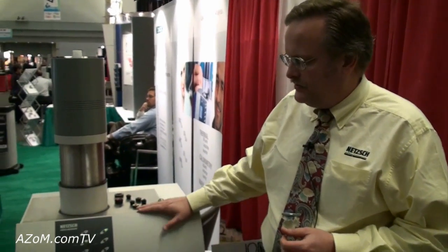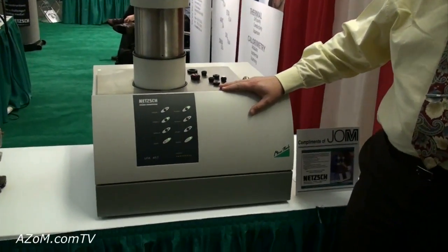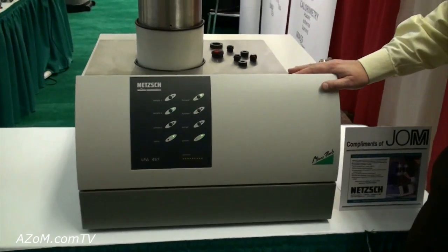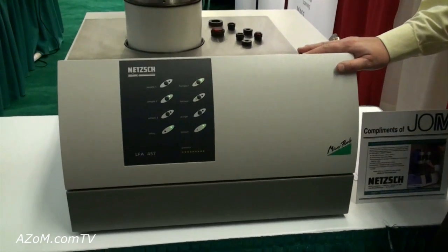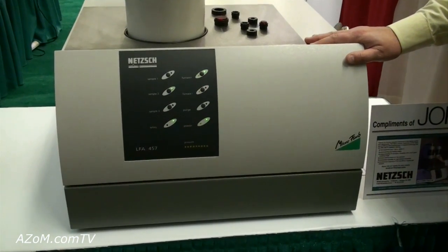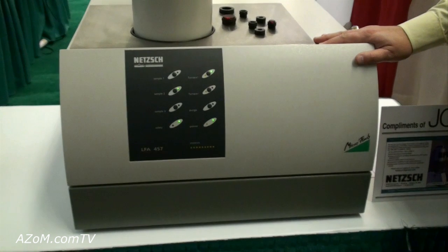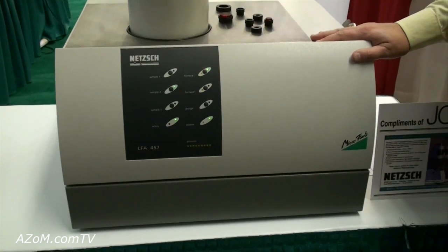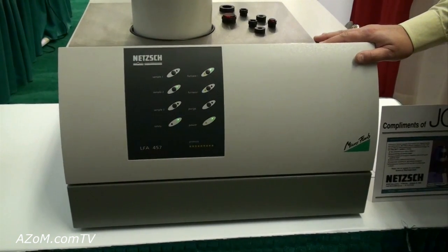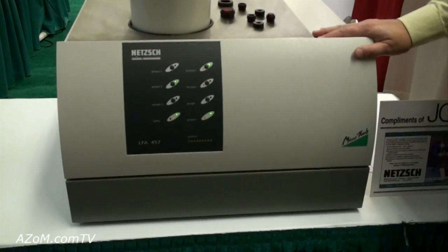This particular instrument can measure samples up to 1100 degrees Celsius, and on the low temperature side as low as negative 125 degrees Celsius. We can even extend that down to as low as negative 150 with a special detector assembly.